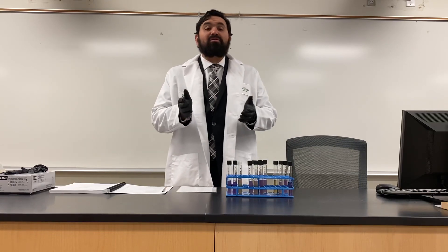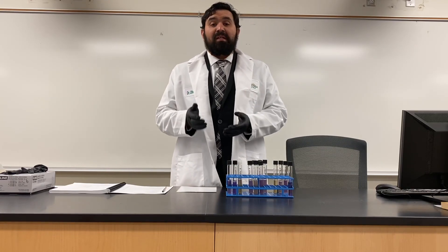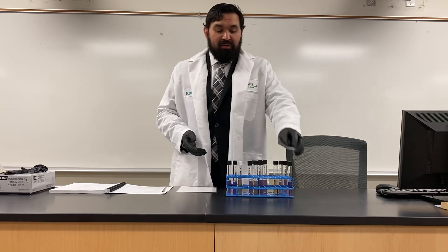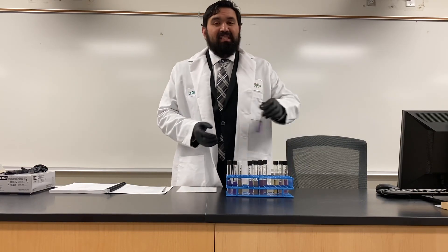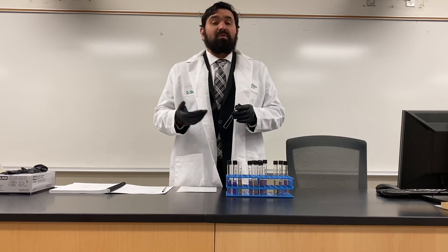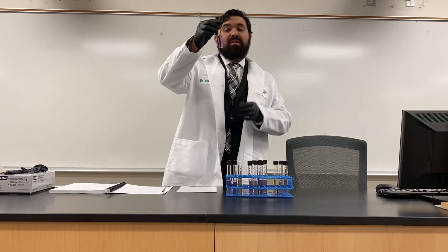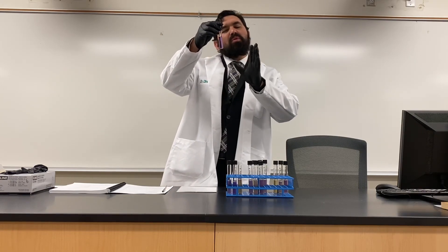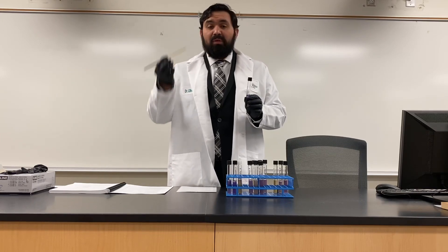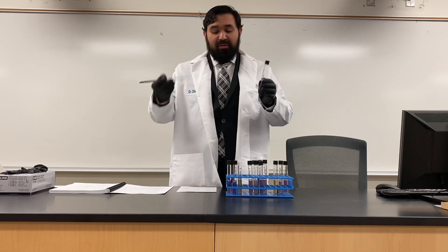For lab 23, we're going to test a similar idea in terms of what an organism can use for food. Here we're going to test if it can use proteins, and particularly the amino acids that go inside those proteins. What we have usually is media that looks a little bit on the purplish side. The same concept: we're going to take a set of organisms, use aseptic technique, inoculate our samples.